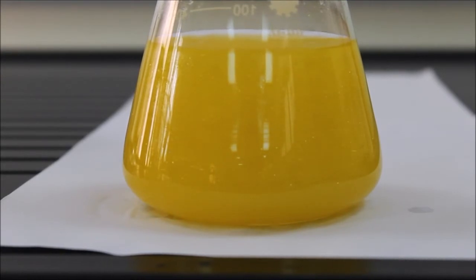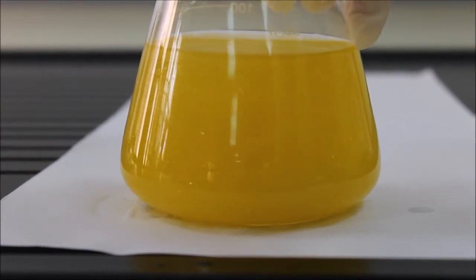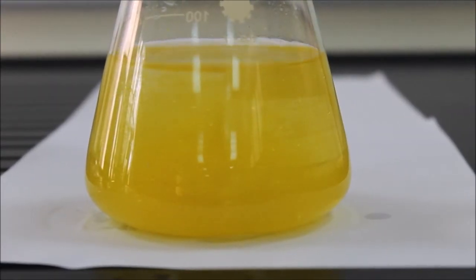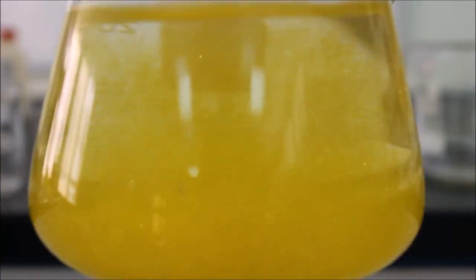As the mixture cools down, it will create crystals from the mixture. Can you see the crystals? It's glittering. This is the golden rain experiment.